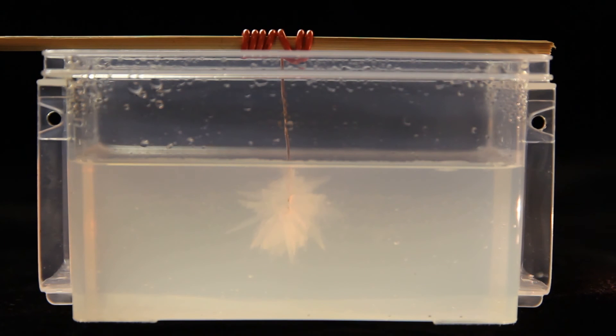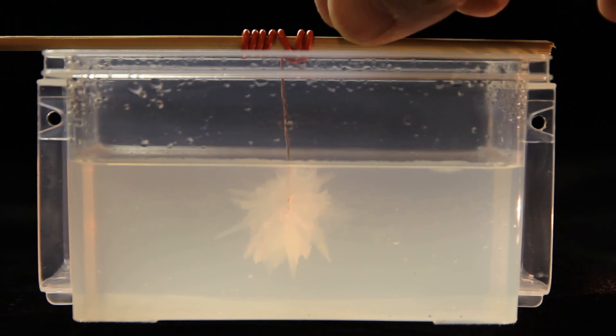The nice thing about suspending the crystal for growth is that when it gets to a point you like, you can withdraw it to see the crystal shape better.